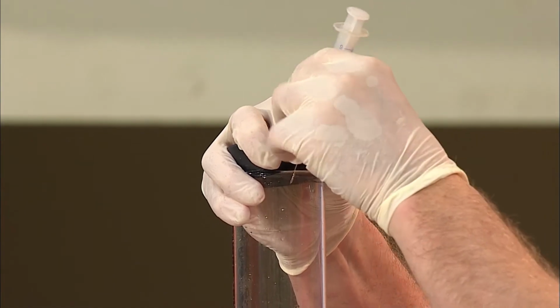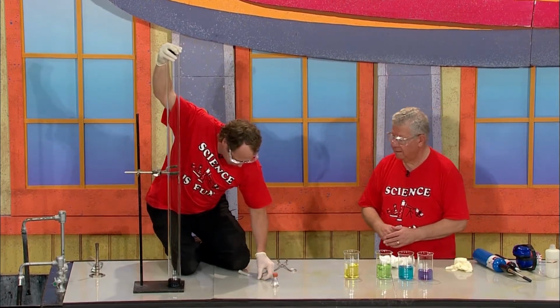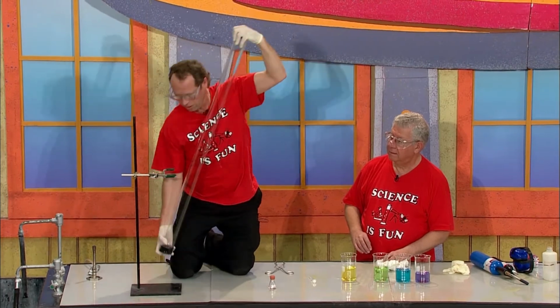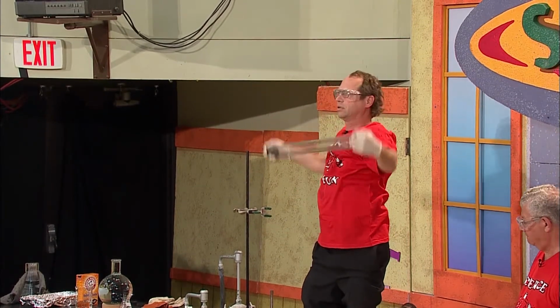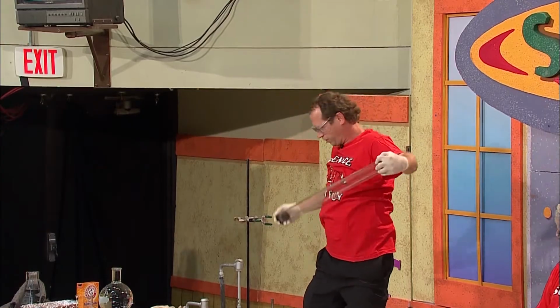And in it goes. And I'm going to mix it in a rather special way as well. So, let's take it off here. Okay. 1, 2, 2.5. Okay, I think we're sufficiently mixed.